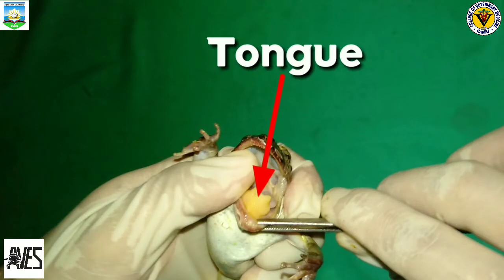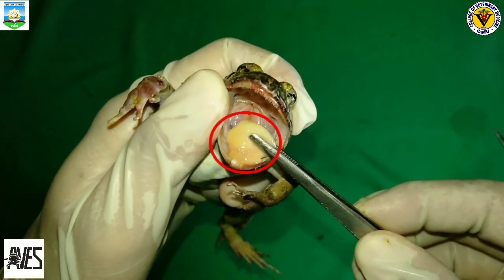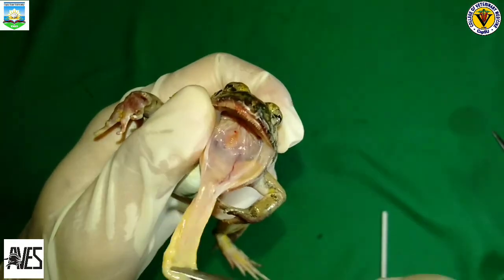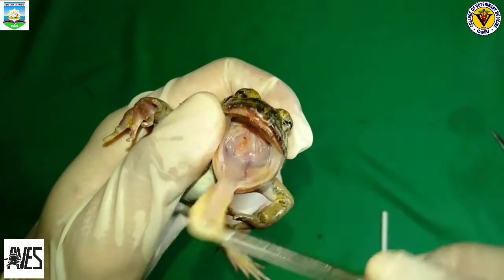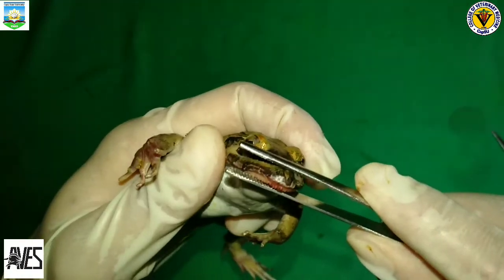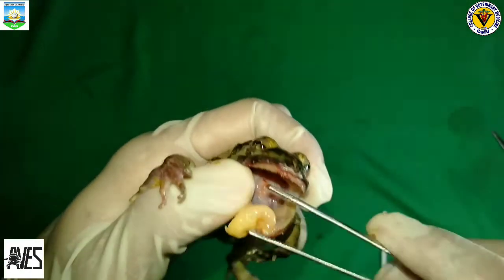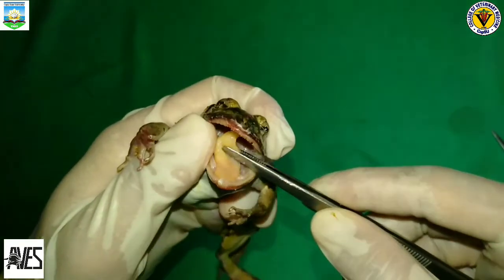We can see now the frog's tongue. Unlike humans, frogs' tongues are connected at the front of the lower jaw rather than at the back of the throat. The frog tongue projects out of the mouth using the inertial projection mechanism. The jaw rapidly opens, the tongue rotates, and inertia of the tissue causes the tongue to project toward the prey. A frog's tongue has super sticky saliva, trapping prey in place like glue. In addition, the frog tongue is attached to the front of the frog's mouth, allowing it to launch almost the entire tongue out of its mouth.